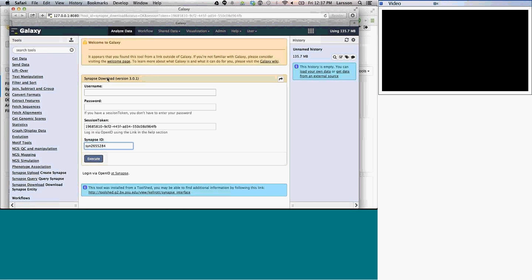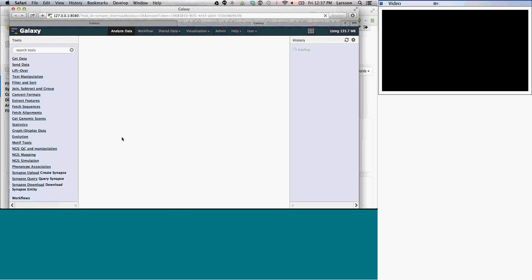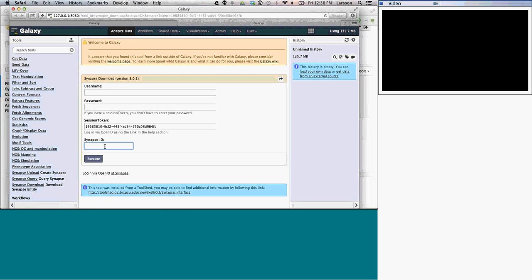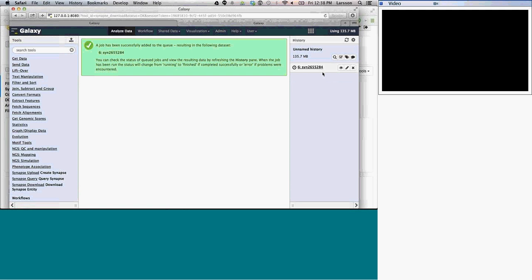So I'm going to say, okay, I want to upload Synapse downloads. I'm going to fetch this data set that we just looked at. I'm going to pick the Synapse ID that I just copied over there. You can put in your username and password, but it's easier to log in using an open ID. You just click on this button right here, and it will open up a new interface that has logged into Synapse. You see it put in a session token here, which means that I'm now logged into Synapse. I'll put the ID in here, and I'll execute the download from Synapse.